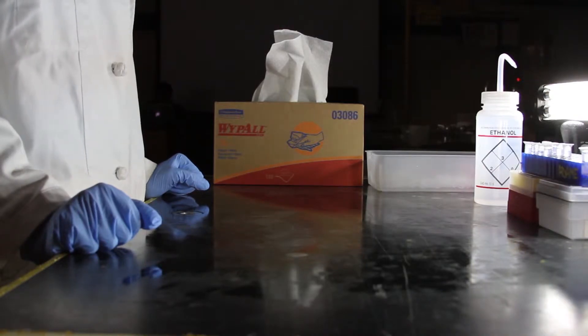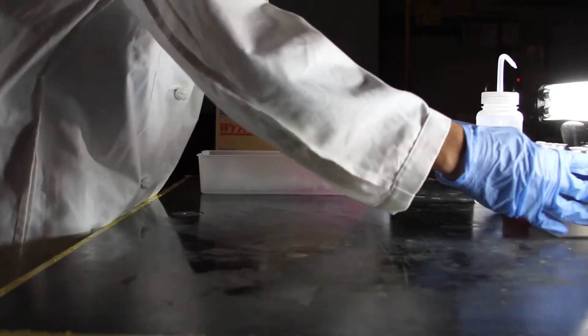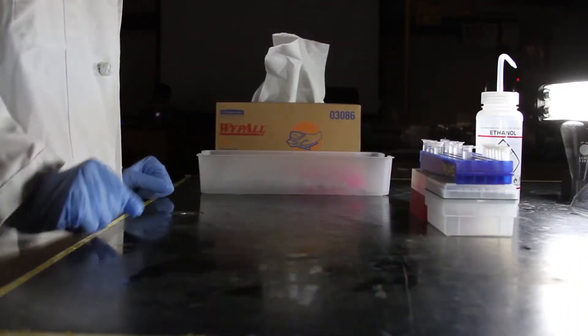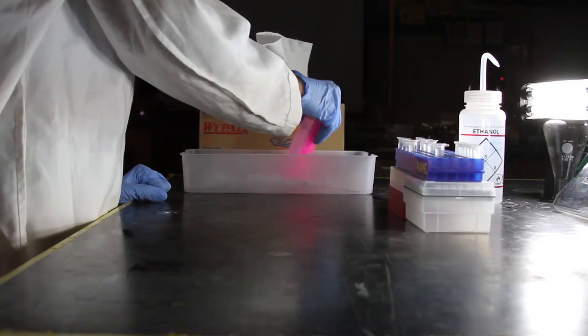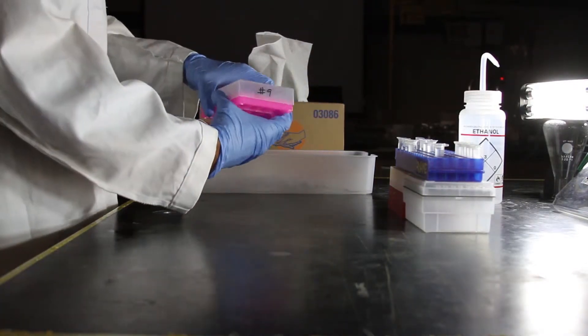Then, we are going to keep all enzymes and buffers used in this section on ice. So, we have tubes labeled Part A, Part B, PSB1C3, and RFP control.